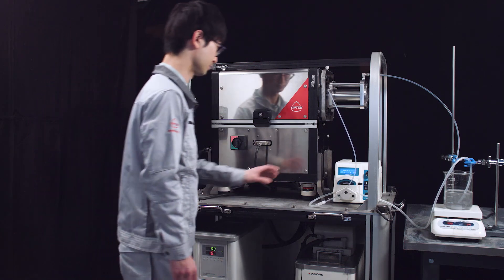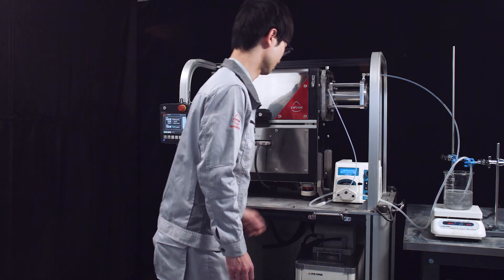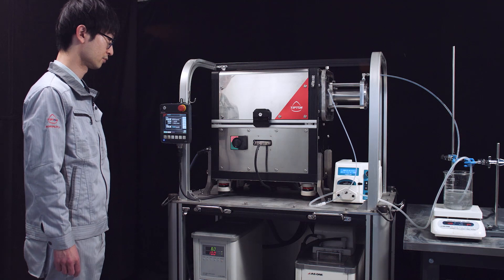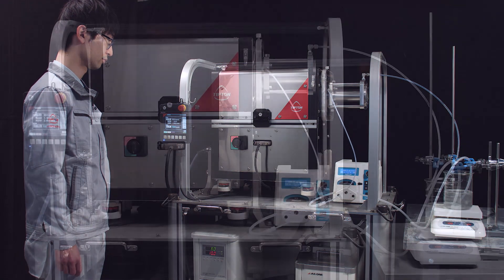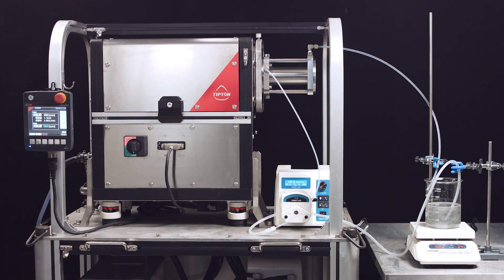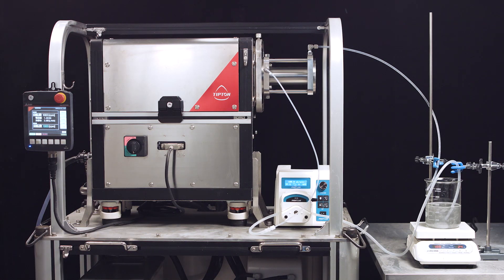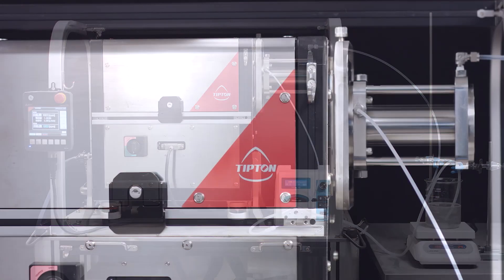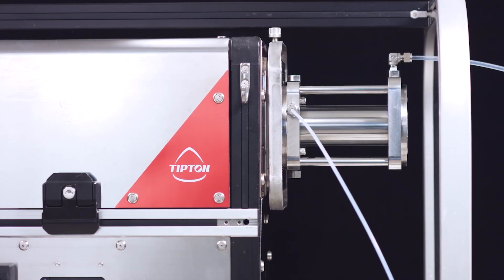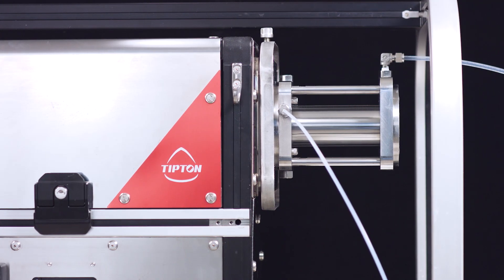TVF is easy to use. In order to generate Taylor Vortex Flow, the inner cylinder rotates and the processing liquid is sent into the TVF. The processing liquid enters through the inlet where it is continuously processed and is discharged through the outlet.